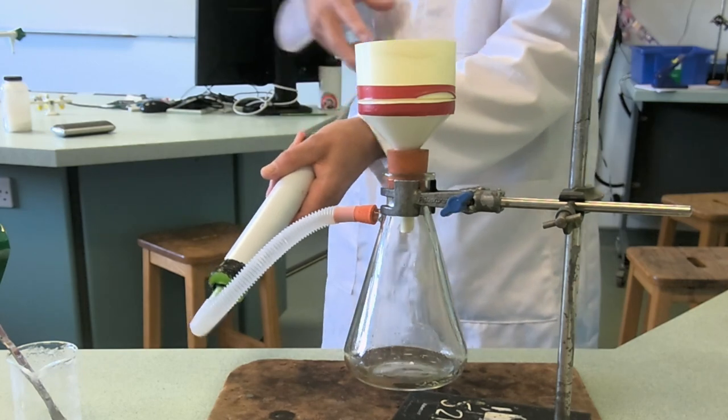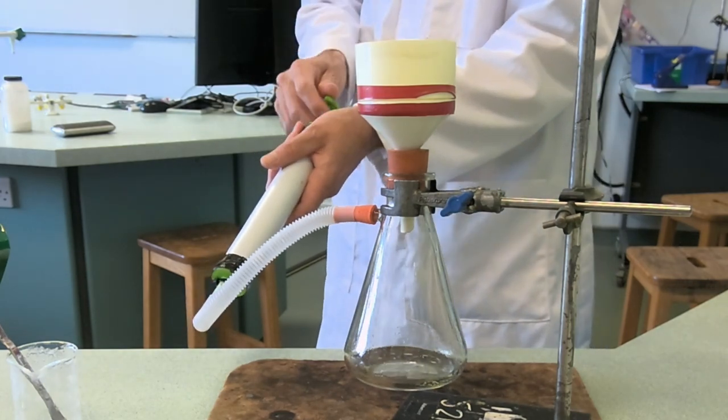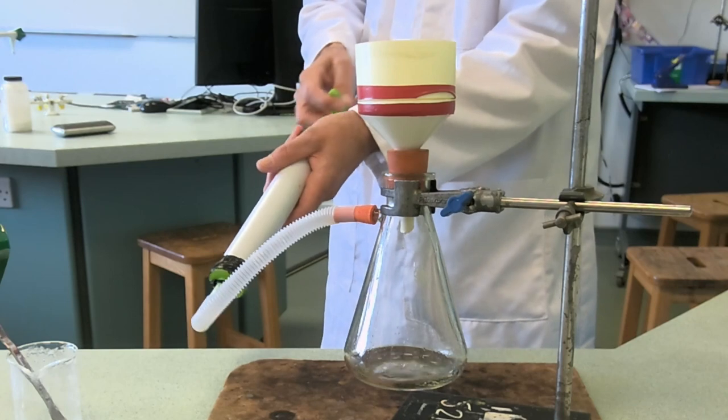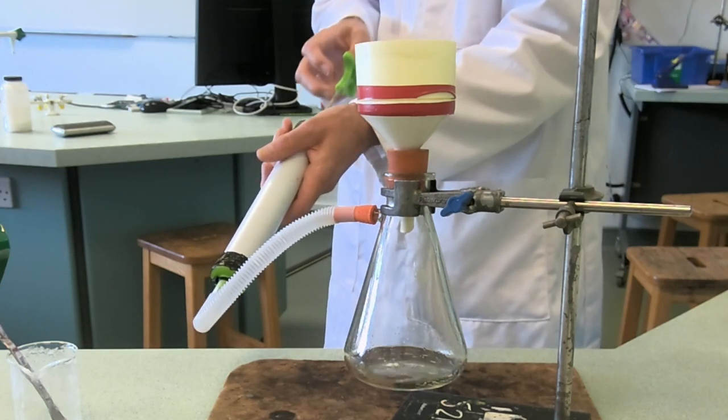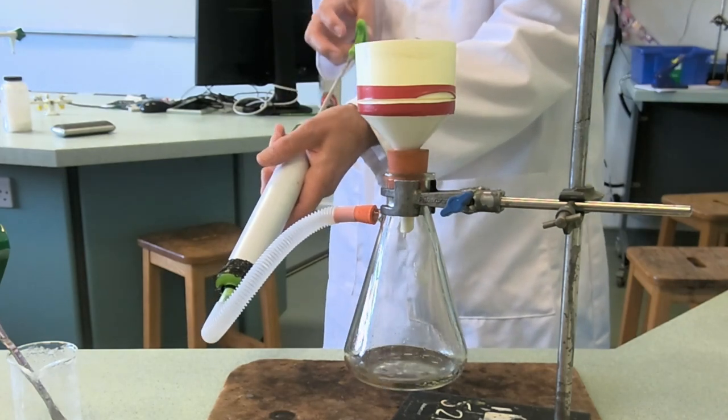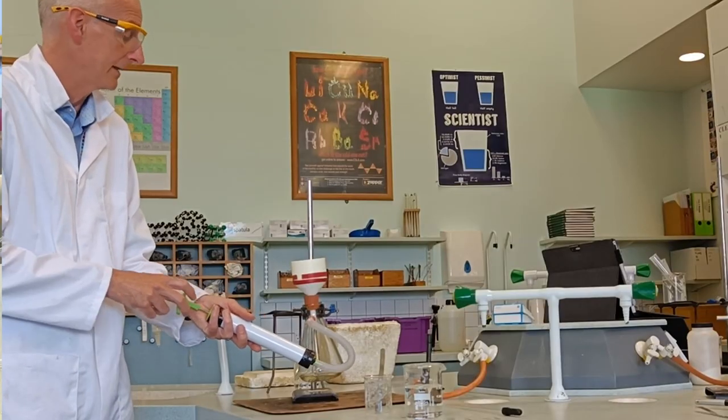We keep doing this until the liquid stops coming through. It can take a while. There's less and less liquid coming through, but the stuff has still got that liquid on it and we want to get rid of that liquid.